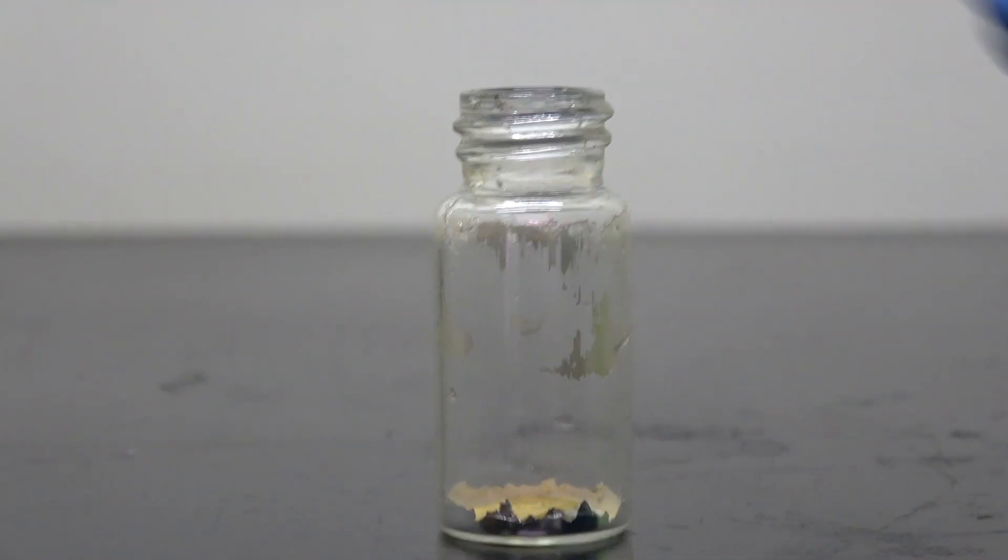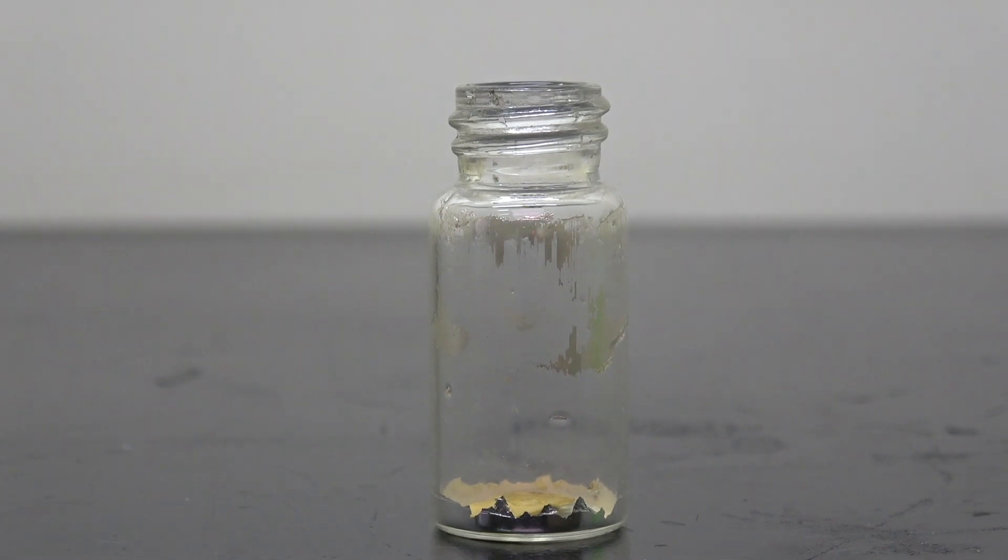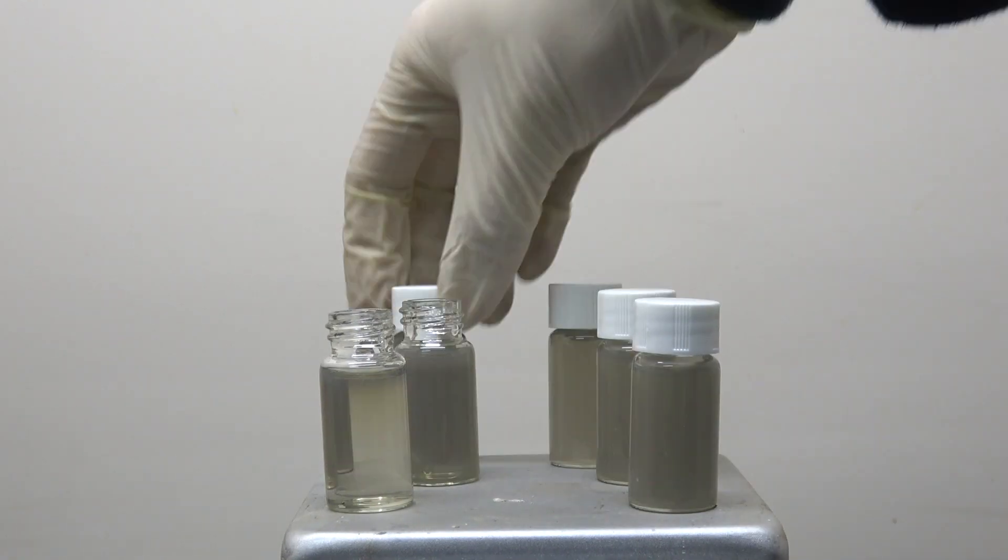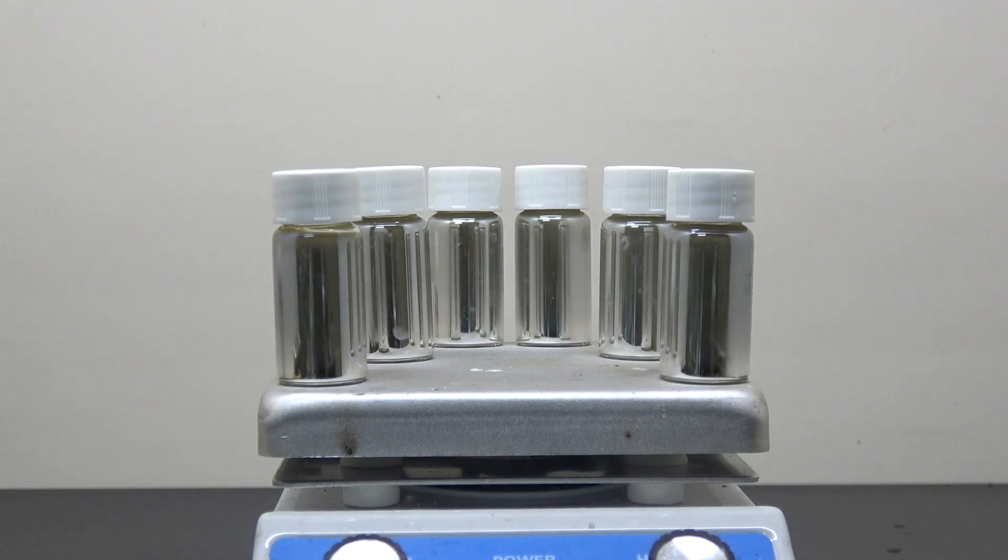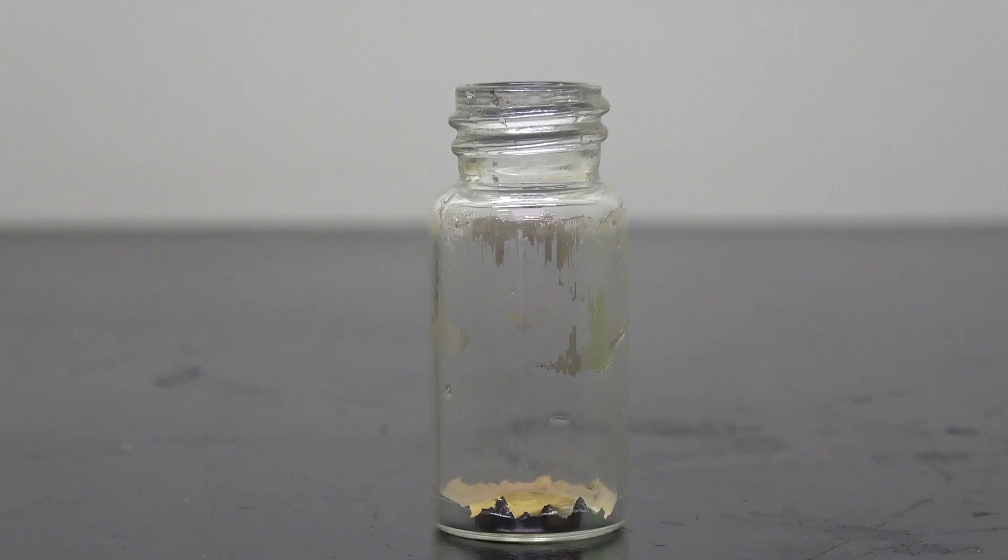Before the big finale with hydrofluoric acid, there is something I want to try first. The coating of this vial is made of silver, as this is one of the failed products from my silver mirror project, in which some of the silver coating did not stick too well. But now I have found a use for those junks.